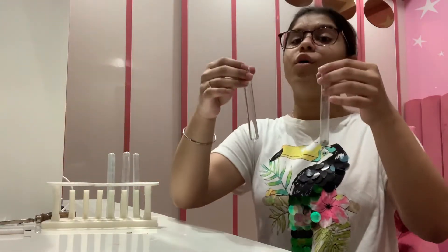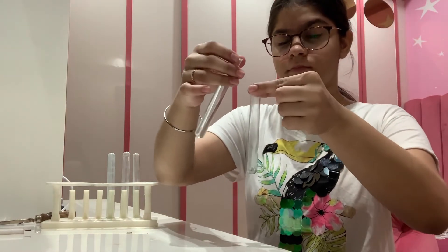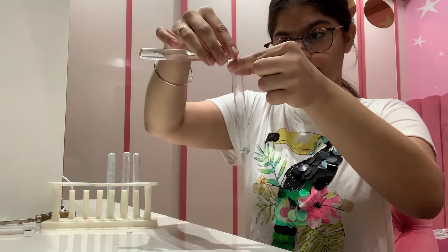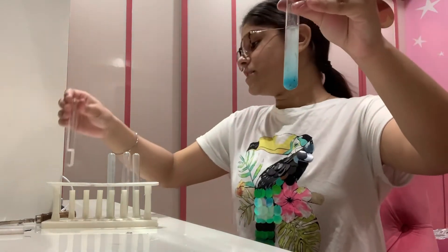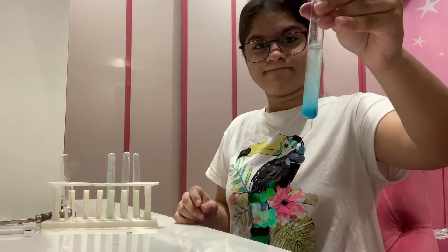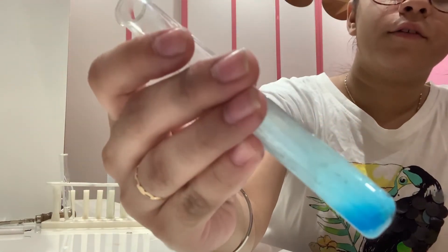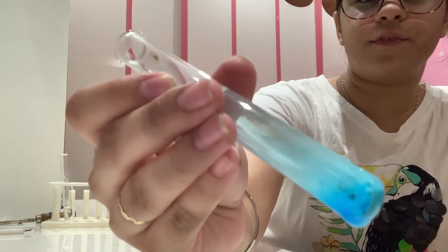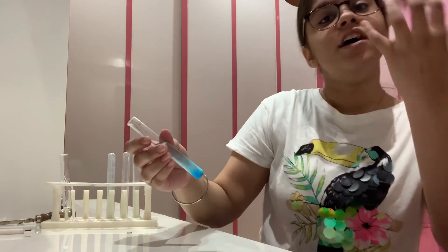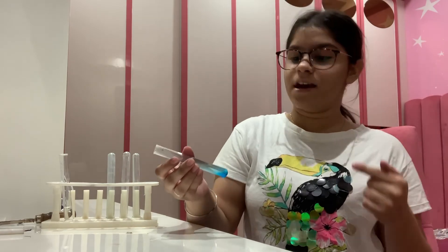Now let us add water to it. So in this test tube, I have water. We can see that the anhydrous white copper sulfate has now turned blue, which means that when we added the water, it regained its water of crystallization and turned back to the hydrated copper sulfate crystals.